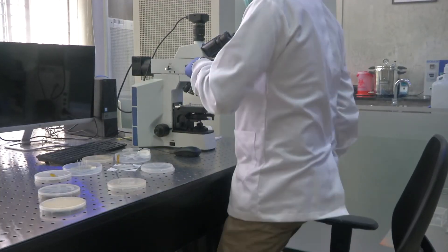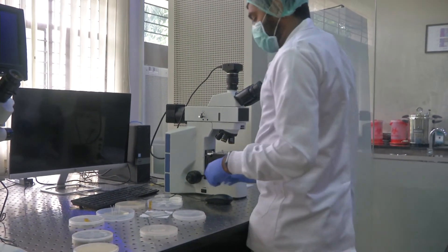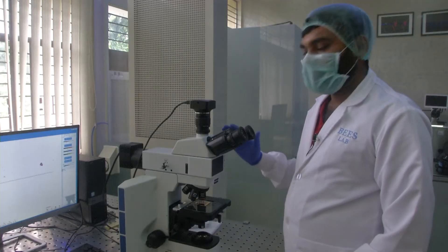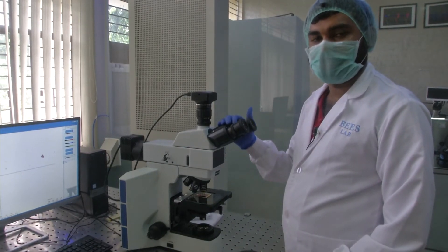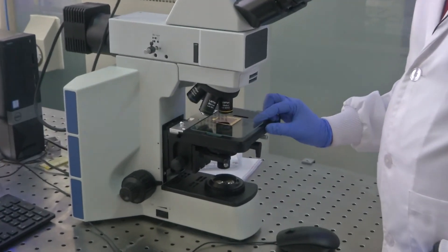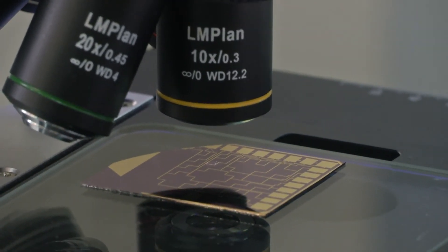We are using a metallurgical microscope to view this sample and we might have to go up to almost 20x magnification to see the features. So let me switch on the monitor. This is a metallurgical microscope — we have seen this microscope as part of this course. I have kept the sample here under 10x magnification. Here you will not be able to see what is there directly — we will see it on the screen.